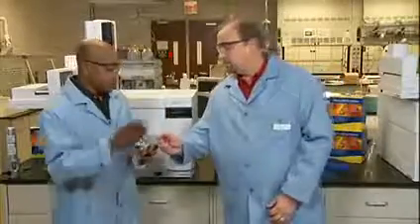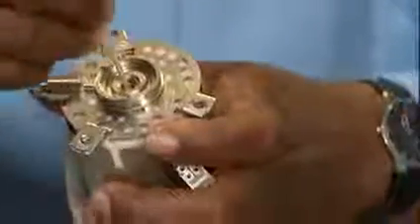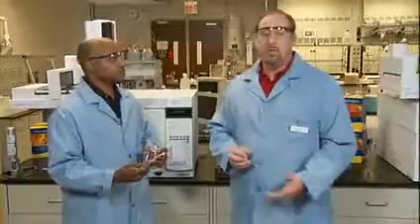Then you would take a long Q-tip soaked in solvent. If you're using hexane to clean the syringe, hexane should work. Then you would run a long Q-tip along the sides of the weldment to remove any contaminants. So if you're getting sample backflash, there are steps you can take to prevent it. You can reduce the injection volume, lower the inlet temperature, change solvents, and/or use a larger volume liner. You can also try pressure pulsing the injection if you have that capability.